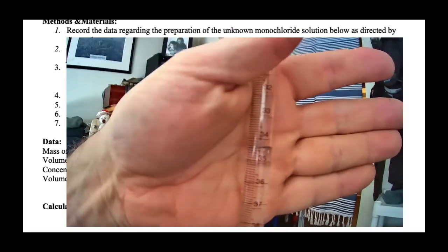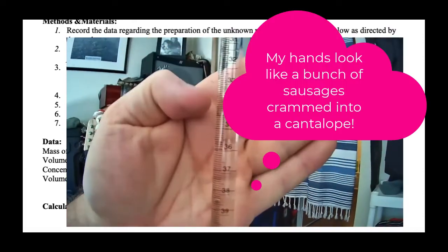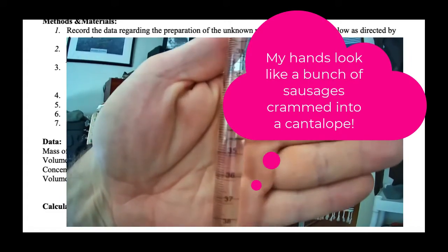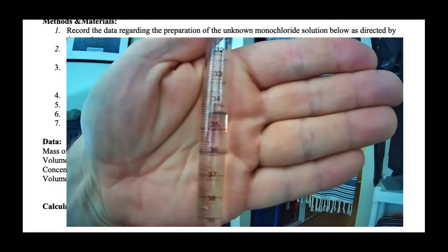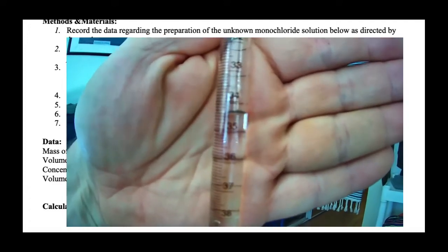And you'll notice it's graduated upside down. So our meniscus, which is right there, is between 34 and 35. It looks to me like 34.4.